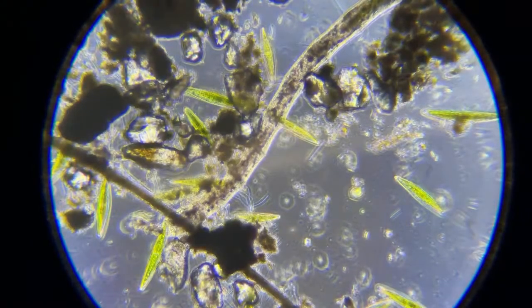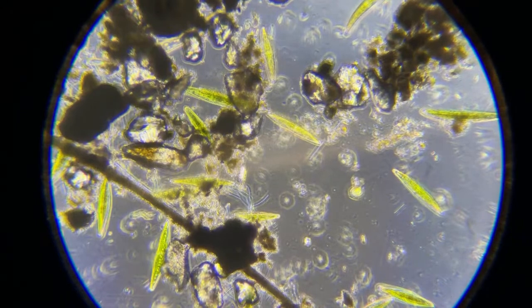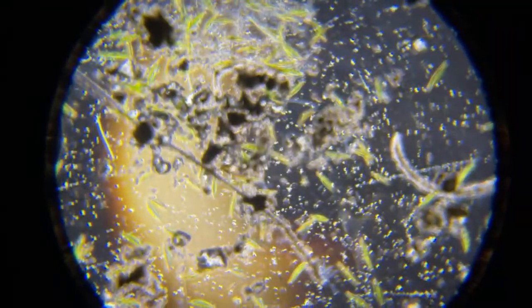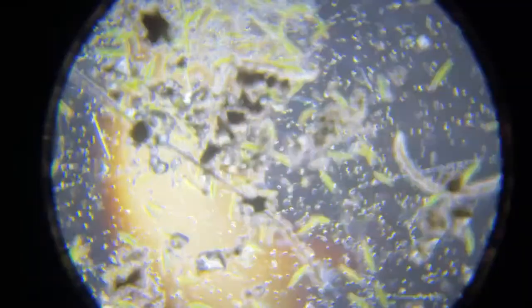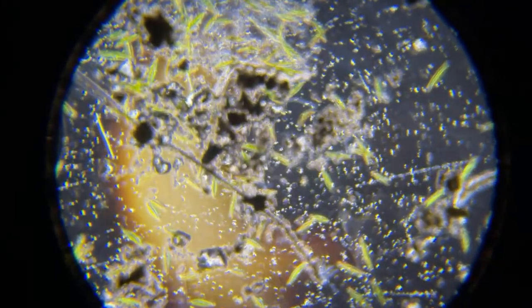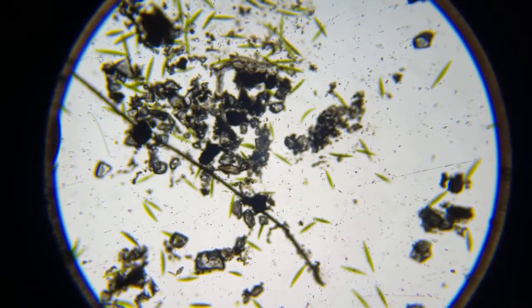And see that line right there? I got to find out what that is. That's something in my path. When I cover up my light under here, I see that line going through. So that's something up above. And the way you can tell if that's in my phase contrast, if I cover up this, see it's still there? So that means something is somewhere, a hair or something is above my light, but below my camera. So really aggravating.